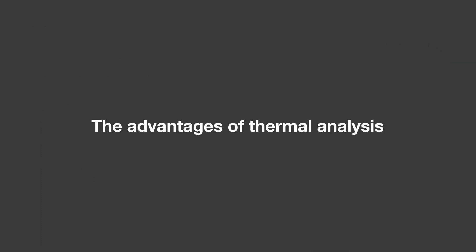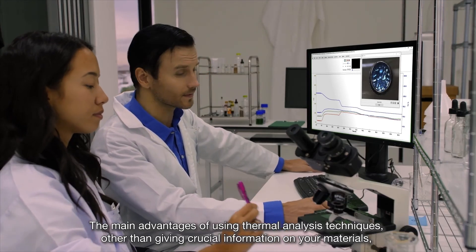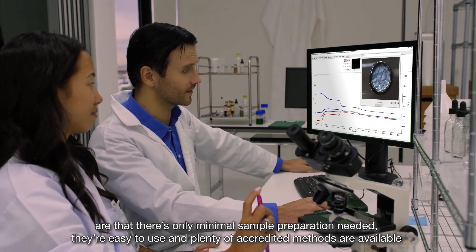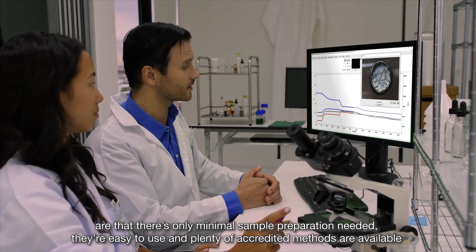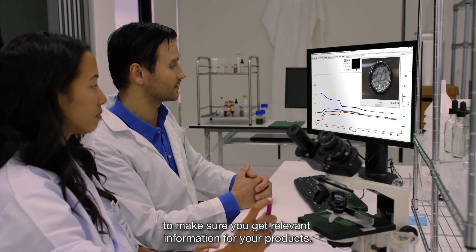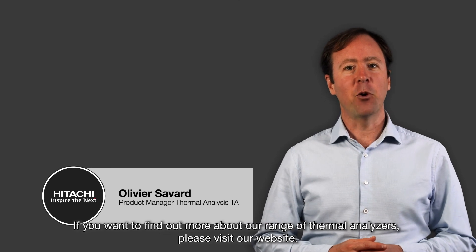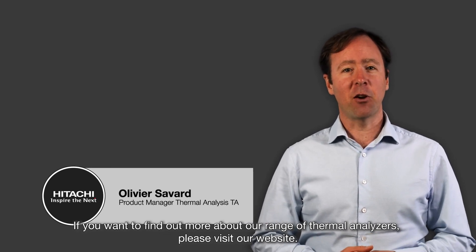The advantages of thermal analysis: the main advantages of using thermal analysis techniques, other than giving you crucial information on your materials, are that only minimal sample preparation is needed, they are easy to use, and plenty of accredited methods are available to make sure you get relevant information for your product. If you want to find out more about our range of thermal analyzers, please visit our website.